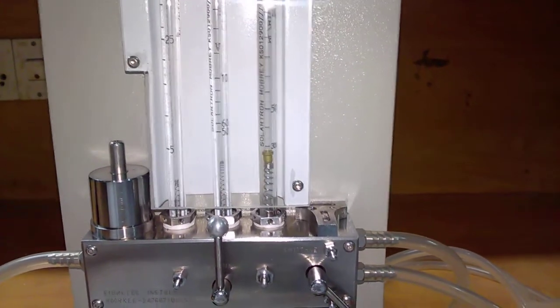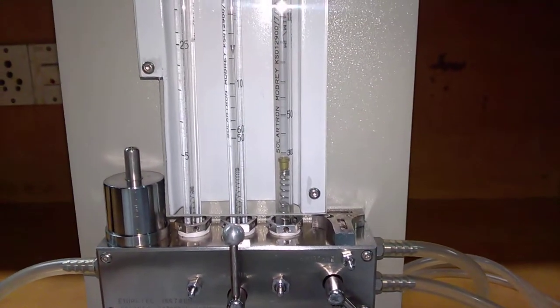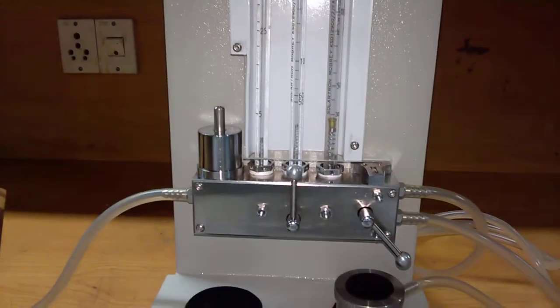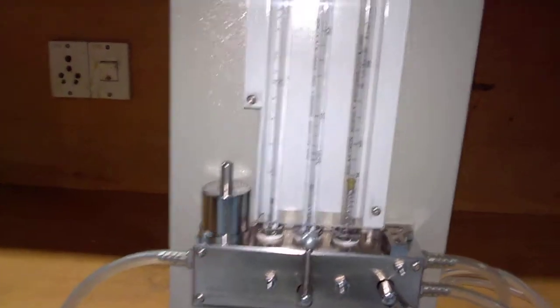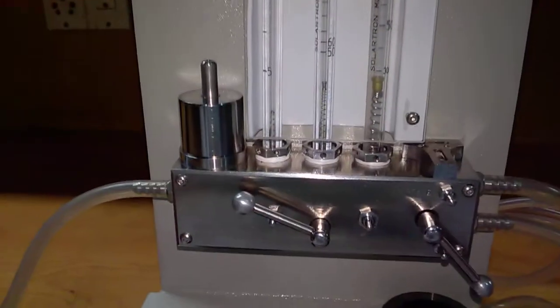It's 130 around. You can see, you can check it over here. It's 130 around at this particular position.